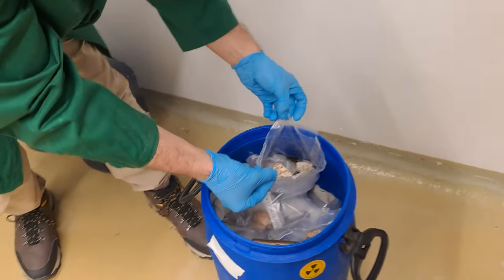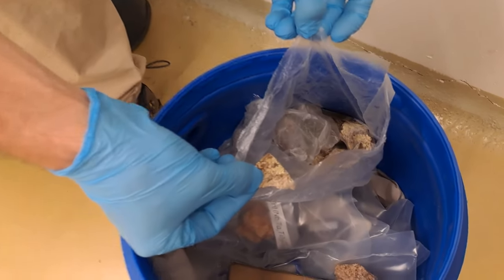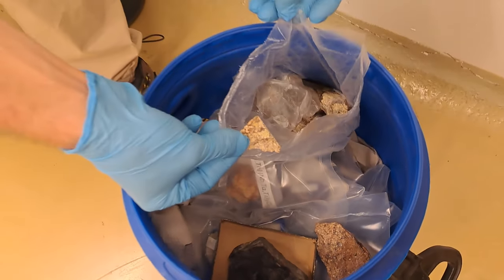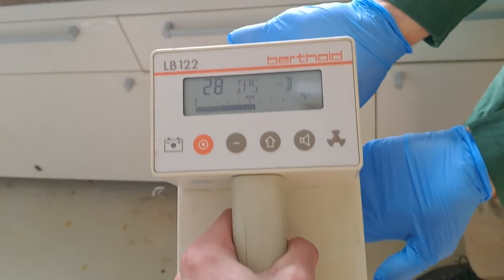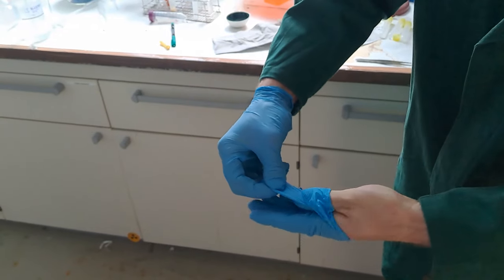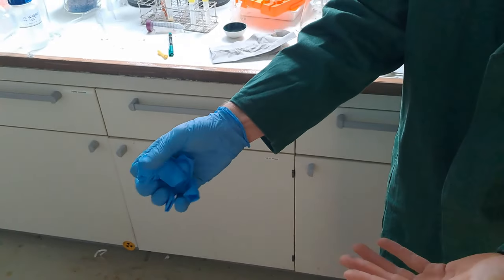By grabbing into this barrel, I probably have contaminated myself, so I need to test for that. And if we measure for radioactivity, we can actually see that there is uranium dust on my gloves. So I need to get these off my hands with the right technique without contaminating my actual skin.